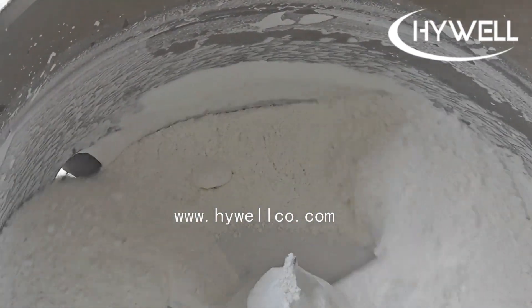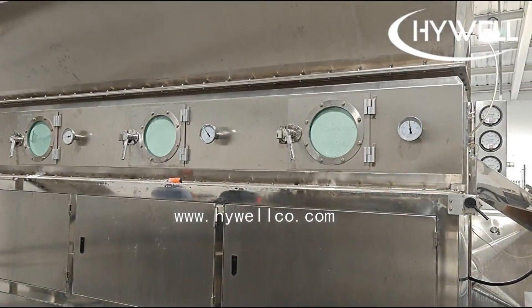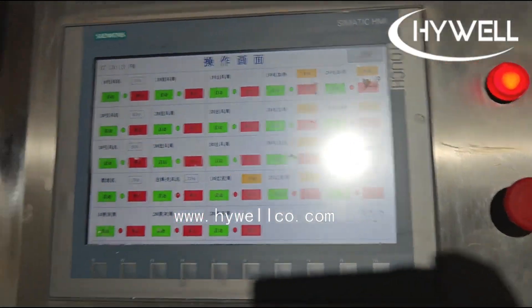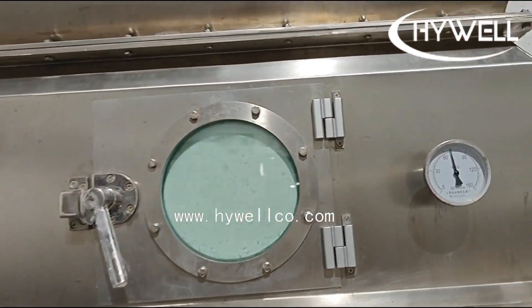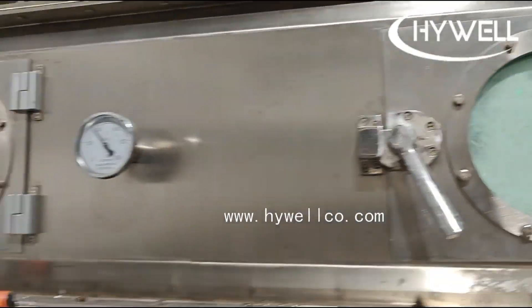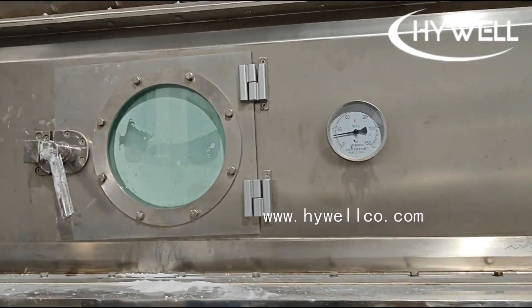The particles that meet the customer's requirements enter the packaging stage, and the fine powder and large particles are returned to the front end for reprocessing. The qualified particles after screening enter the packaging machine for packaging, to ensure the sealing and quality stability of the final product.